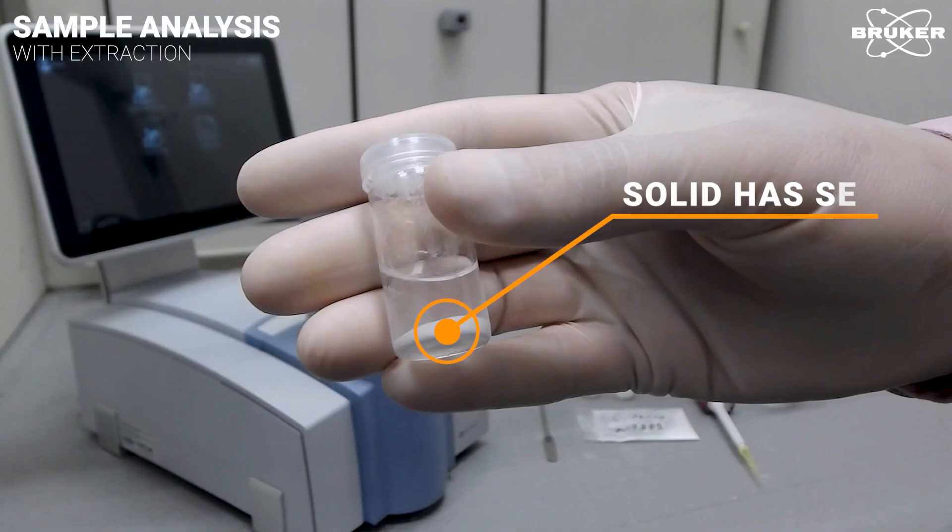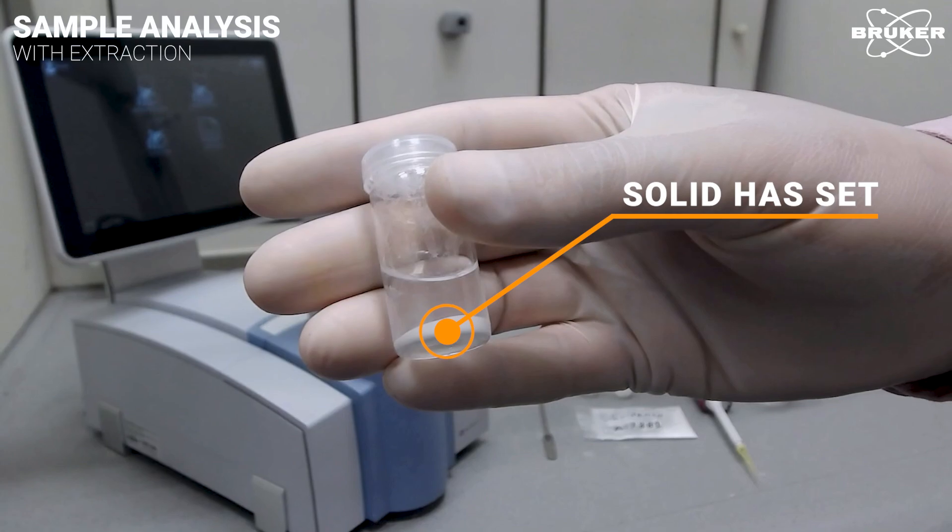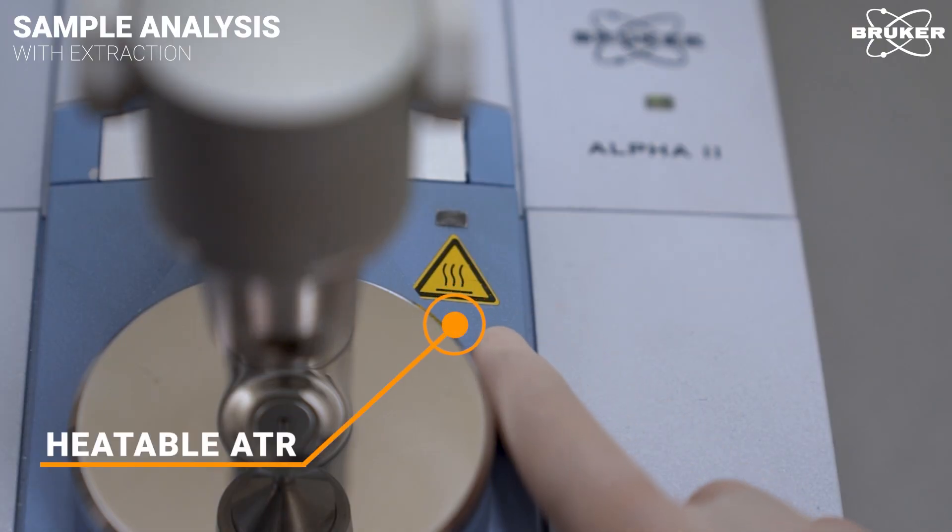The solid has set and we are ready to analyze the solution. By using a heatable measurement interface for quick evaporation of the solvent, we can reduce analysis time from minutes to a few seconds.